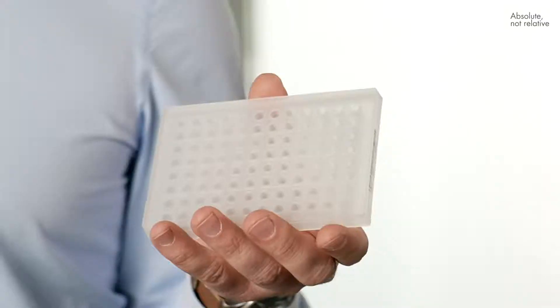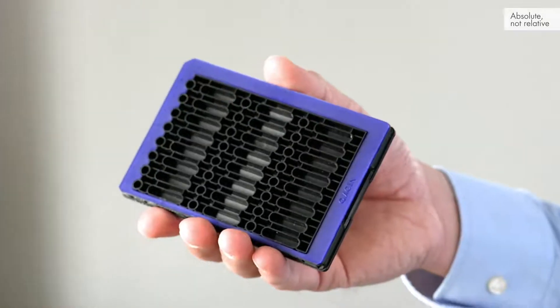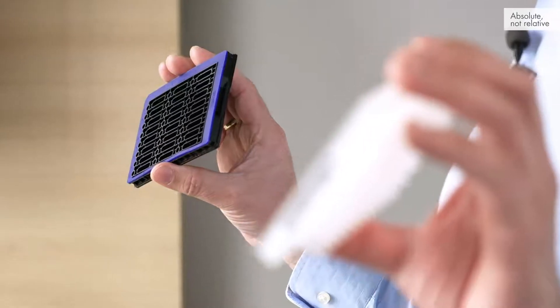When moving from qPCR to dPCR, when moving from a plate to droplets or crystals in a chip, in dPCR it's about counting positives and negatives — the dPCR reaction which you partition into thousands of individual reactions. One way of doing it is oil, so you form droplets in a water-oil emulsion: ddPCR, or droplet digital PCR.